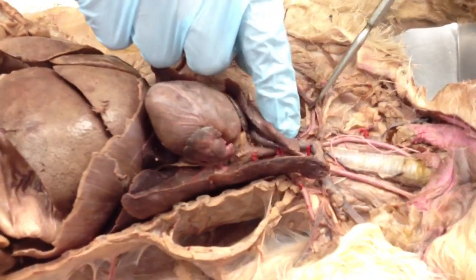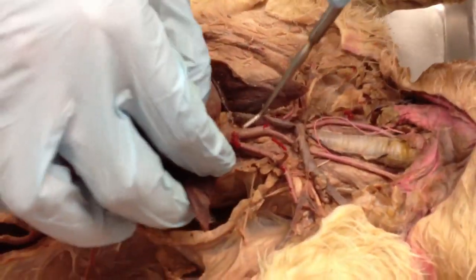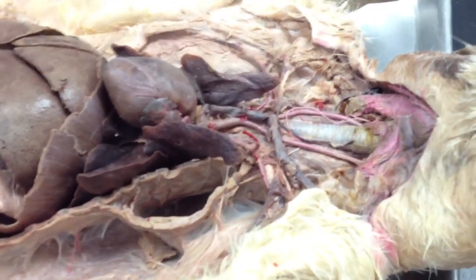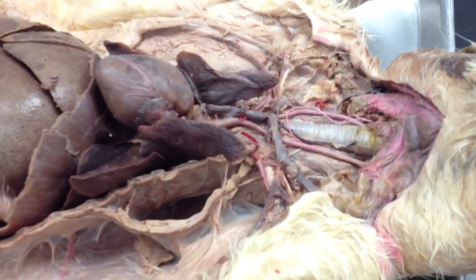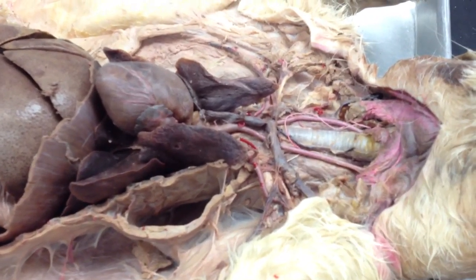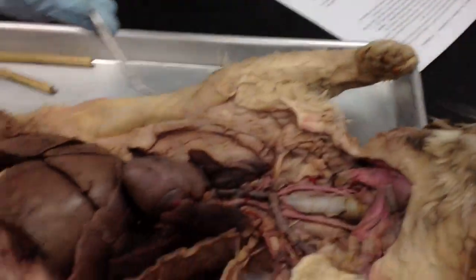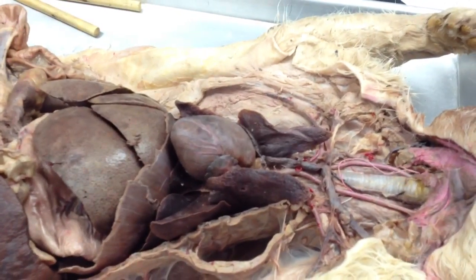And it just kind of ends up being your subclavian artery going in that direction. And remember, your left subclavian over here is just going in this direction. So if you see any artery or vein kind of in the shoulder area or going out to the arms, that's the subclavian artery or vein. Told you not to worry about the coronary artery, but it's these guys kind of running around the heart there. But you don't need to know it because it's not that easily identifiable.